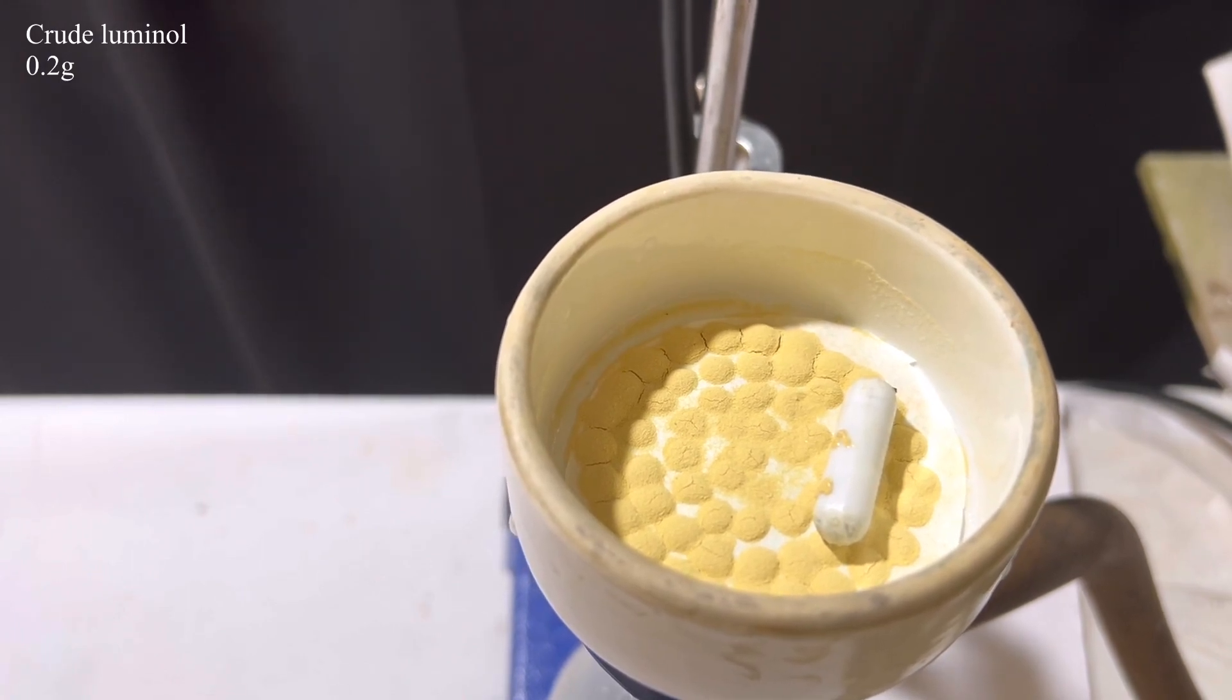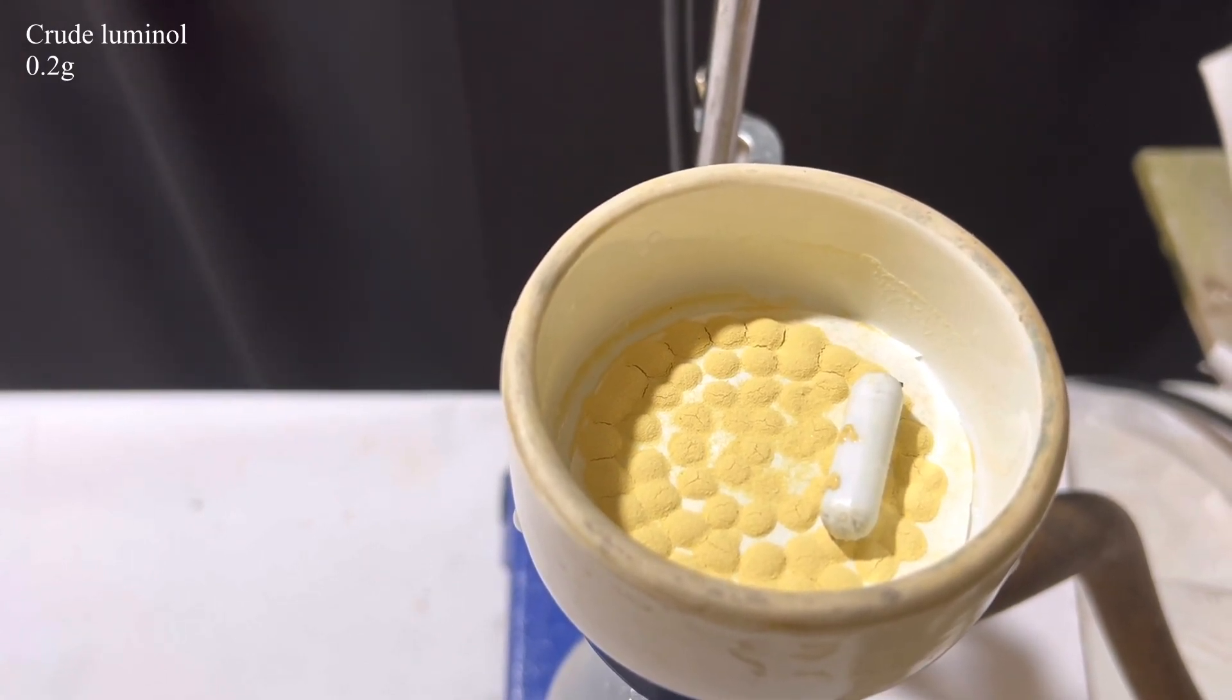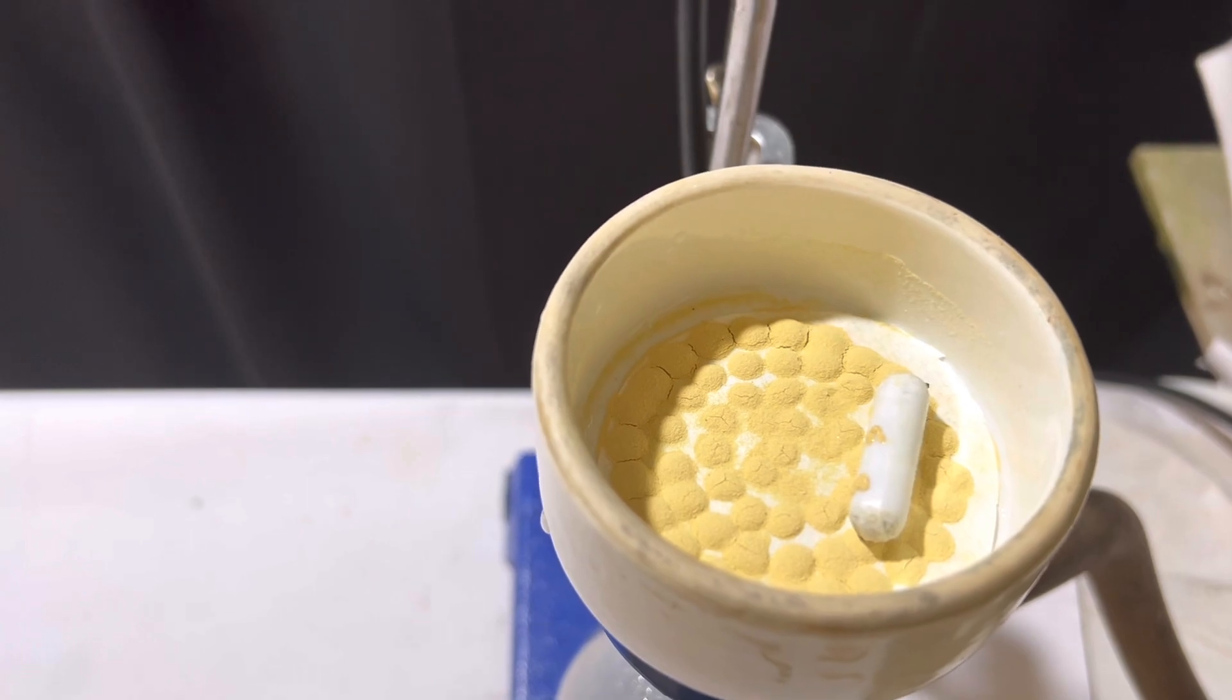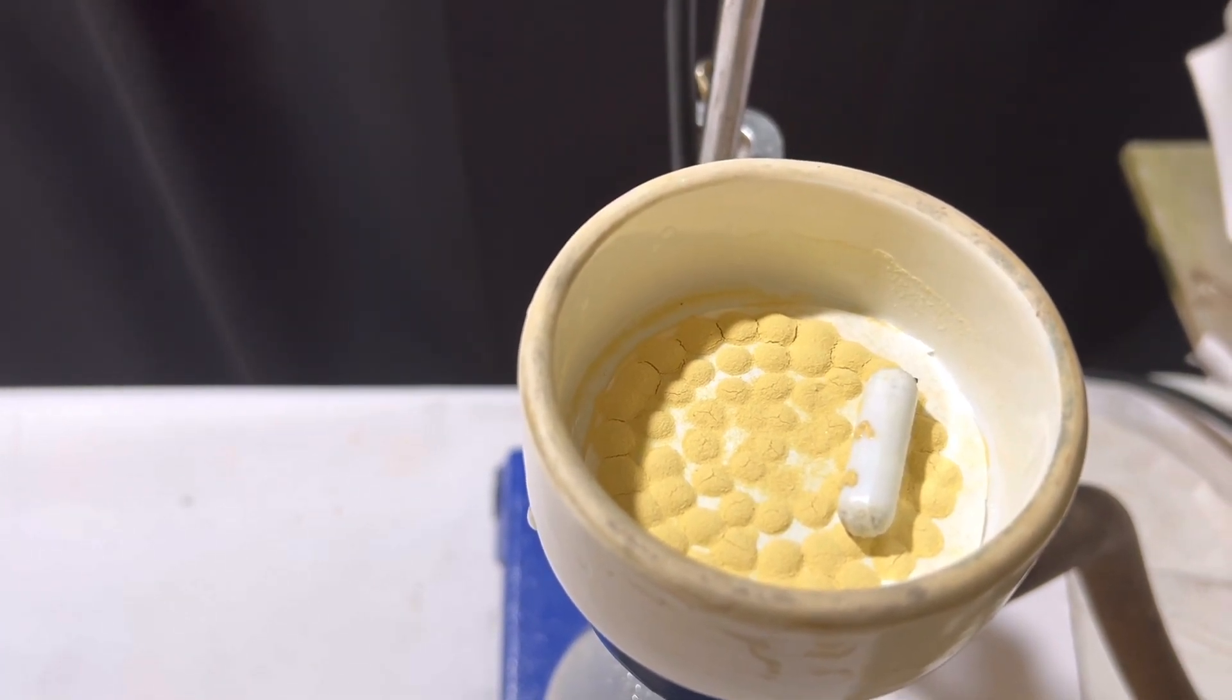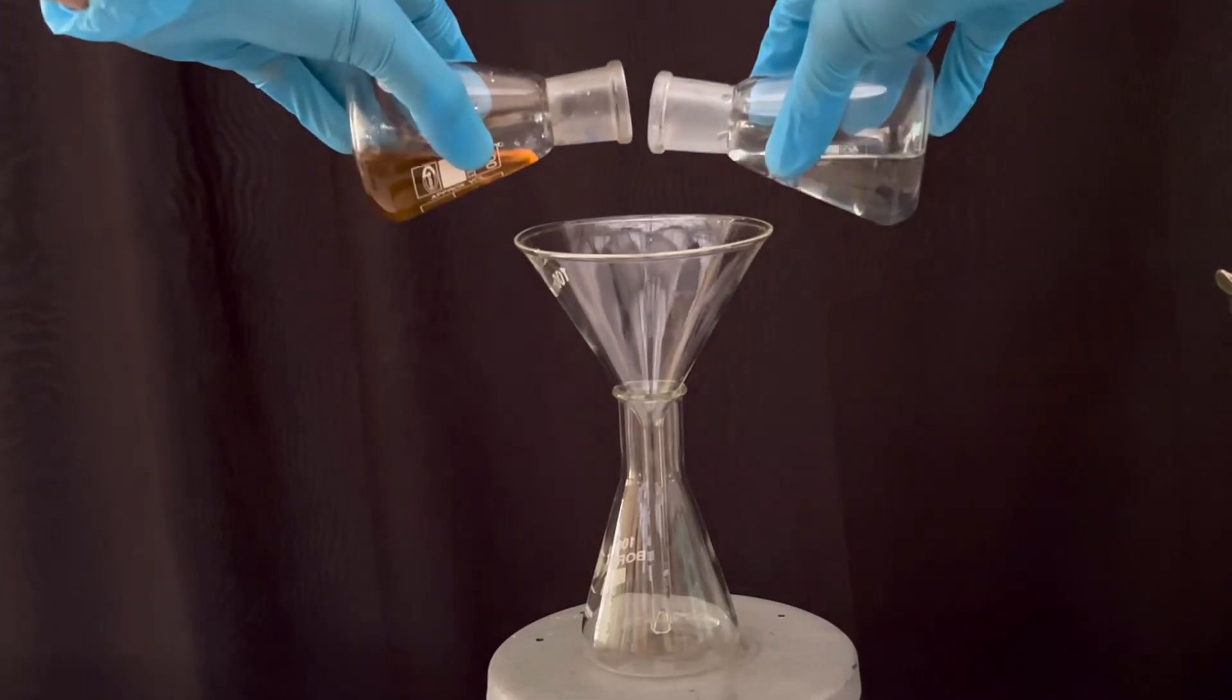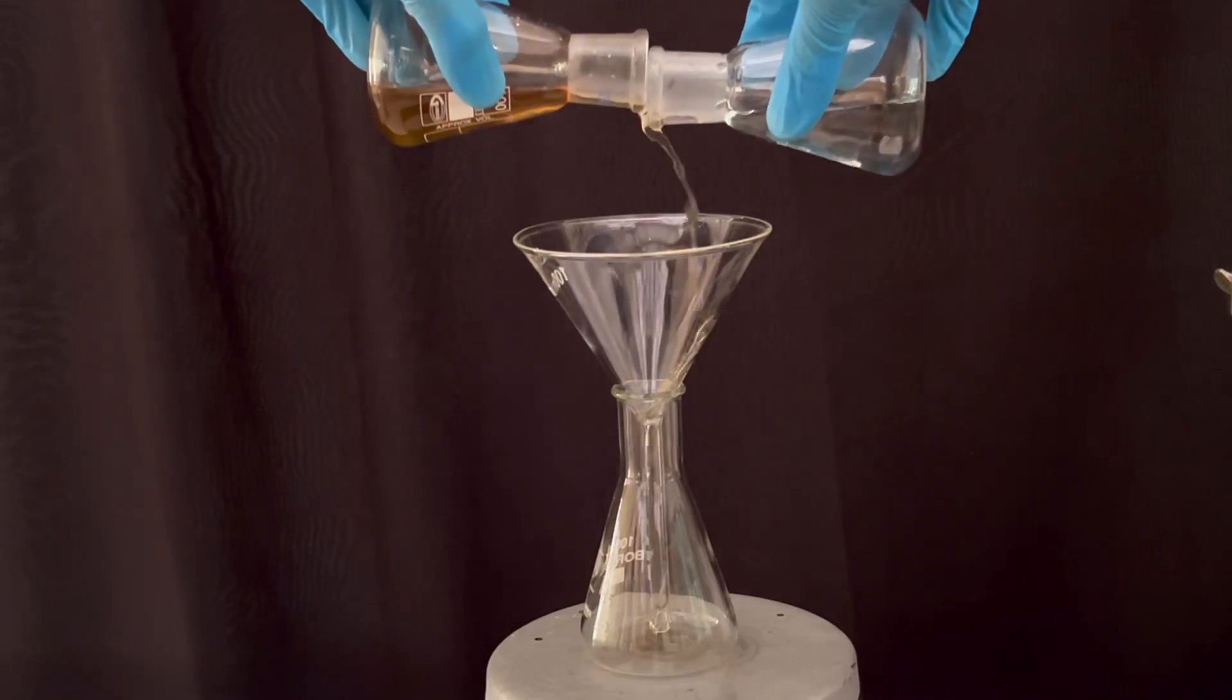The compound seems relatively pure for demonstration of chemiluminescence, hence I did not recrystallize the product. If you want you can recrystallize the product from ethyl alcohol. Now we move to the demonstration of chemiluminescence.